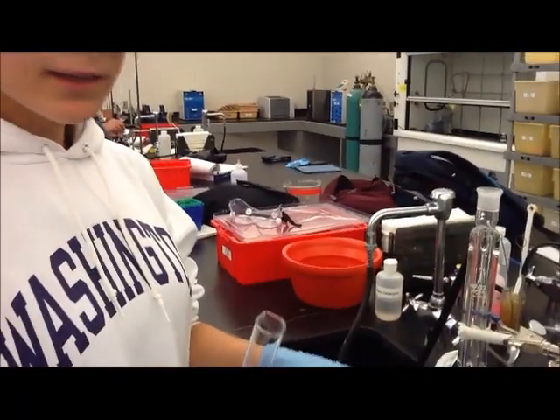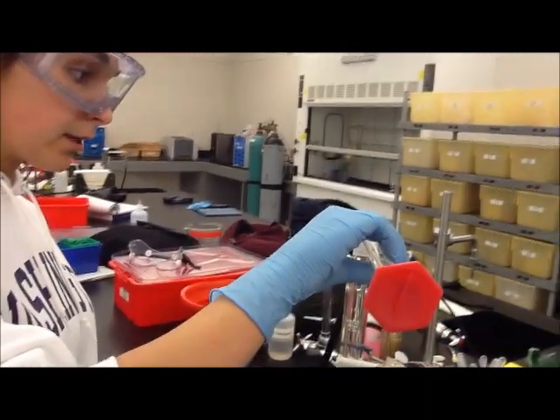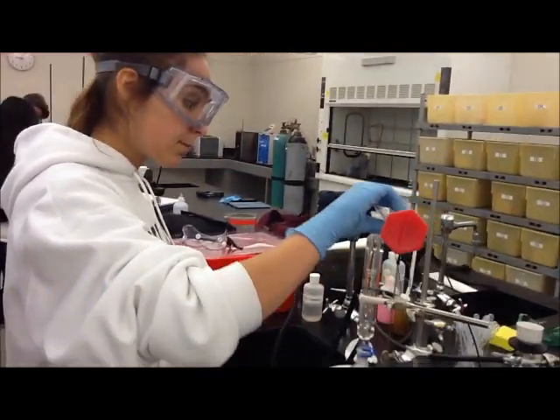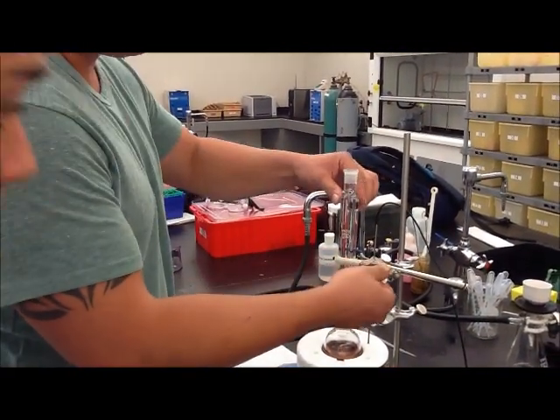We've already added about half the deionized water. Now I'm going to pour in the rest and see if it precipitates. It turned an orange color, and now we can turn it off.